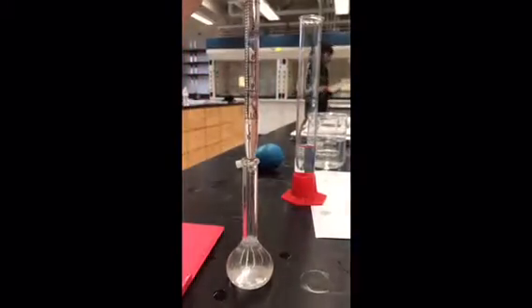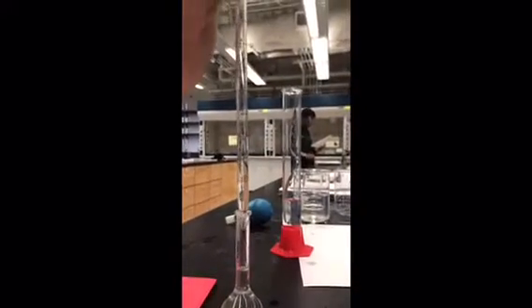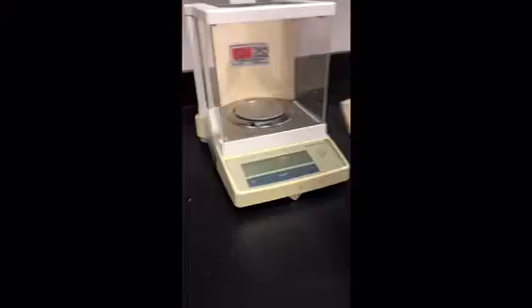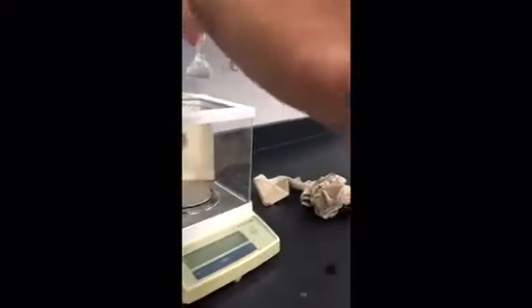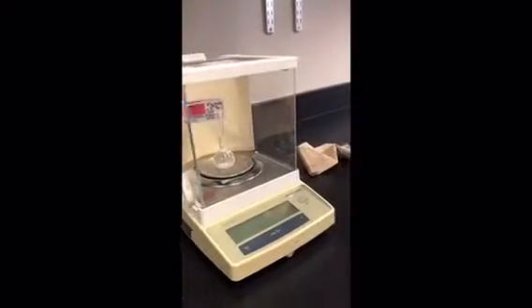Using lab equipment, make sure that each piece is clean so that there is no cross-contamination. Next, we will be moving to use the balance. Prior to using the balance, make sure that it is set to 0 and that nothing is on it. Then, place the flask on the balance and wait until the value on the screen slows to a stop.